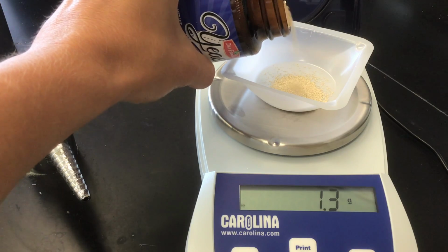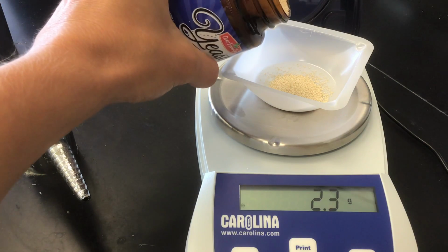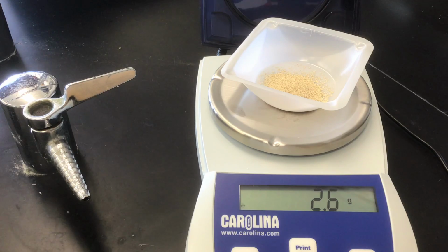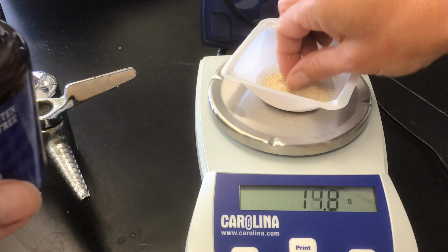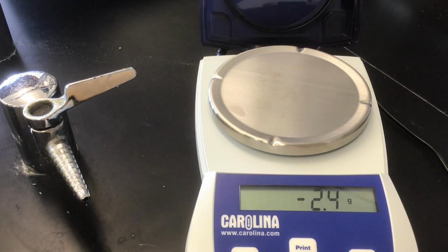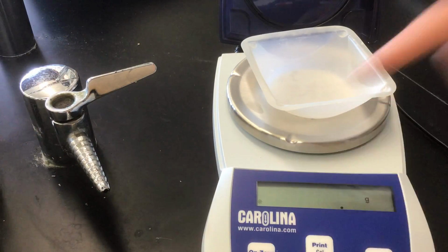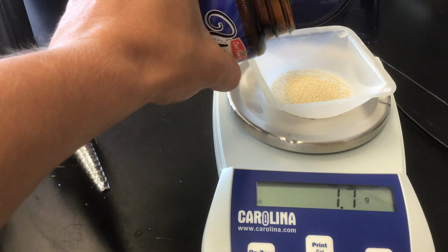See if I can get this close. So you could actually, if you wanted to run something similar at home, use a little bit of yeast if you happen to have some, and some sugar, and see if you can get anything to happen. A little too much yet. There we go, beautiful. So I'm going to mass the same amount, again keeping these things constant among both of our groups, into another weigh boat. That will go into my second test tube.